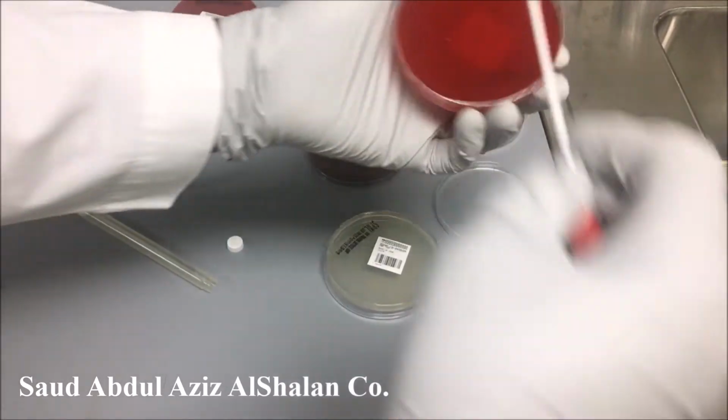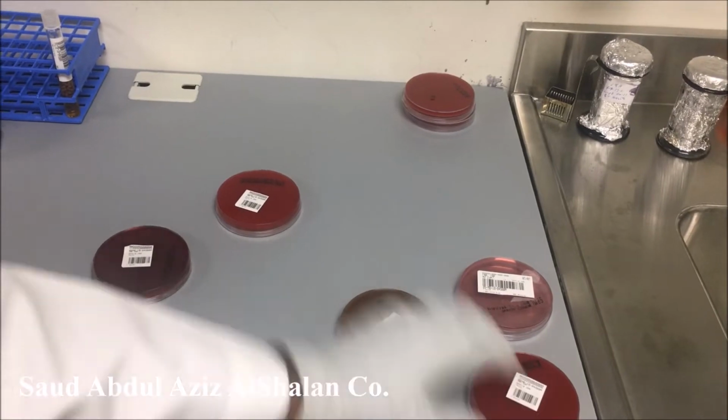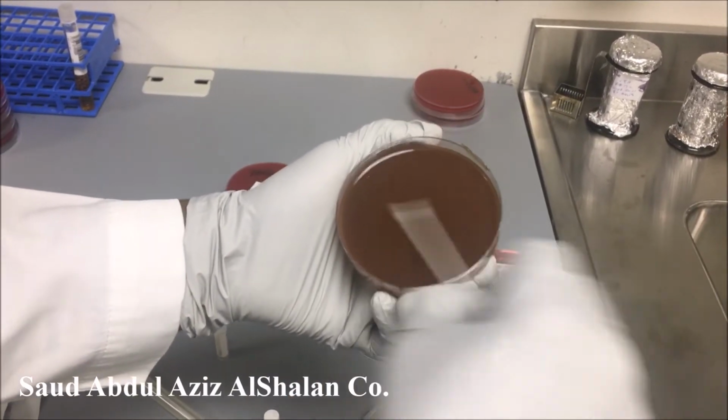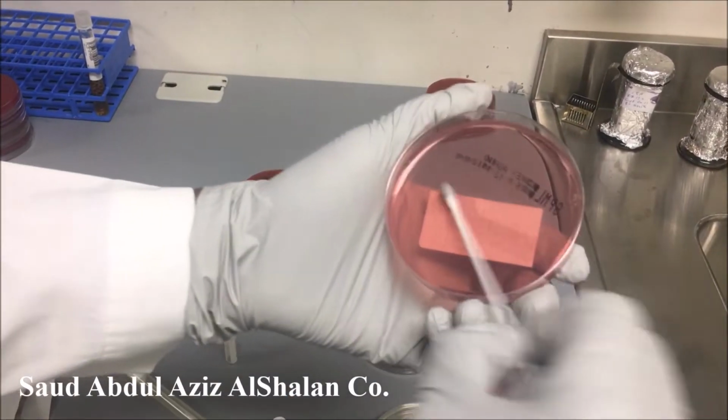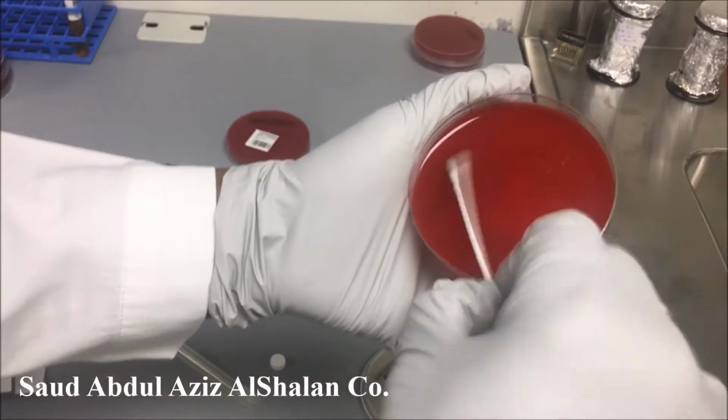Usually we always start with blood, then chocolate. We start first from a basic media, then we go to a selective media.